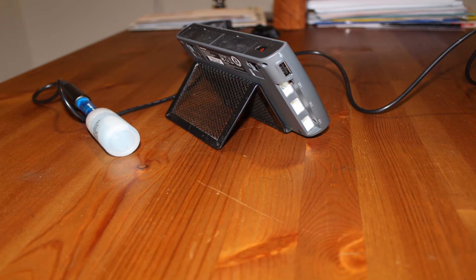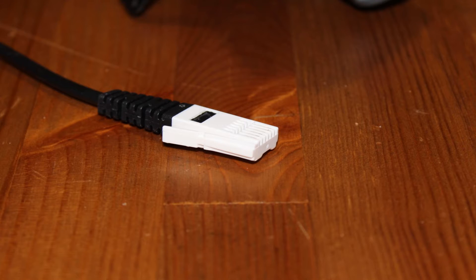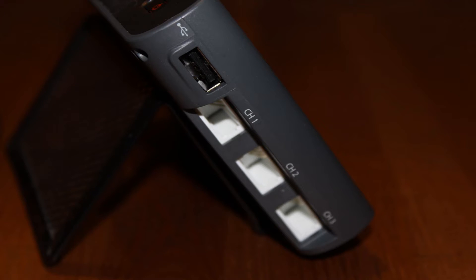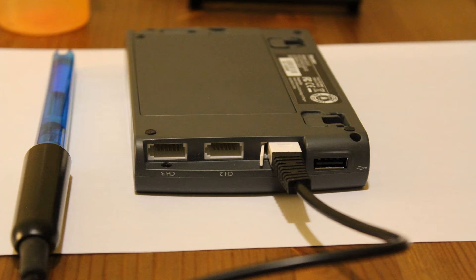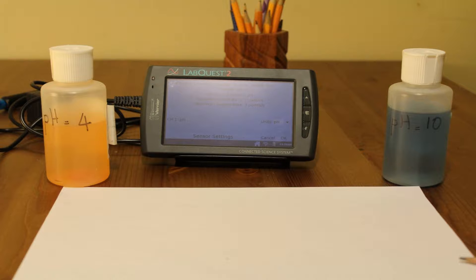Next, you will connect the pH meter to LabQuest 2. Once you have connected the pH meter to the LabQuest as shown, you are ready to calibrate the pH meter.